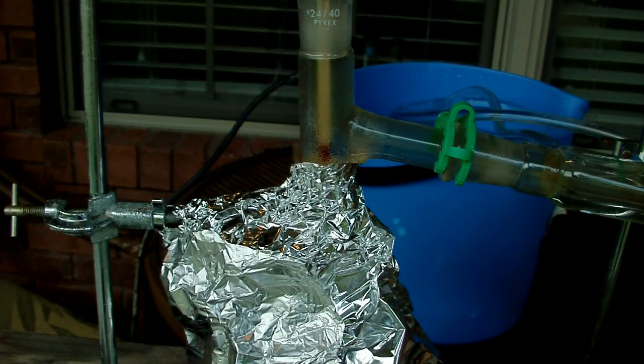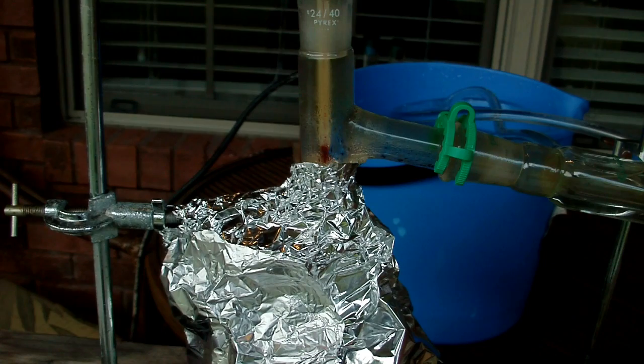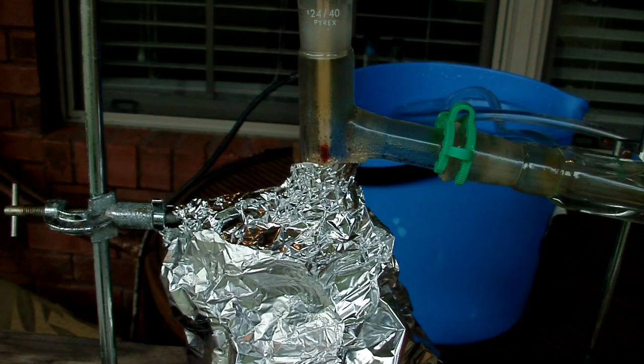So it's been about 10 or 15 minutes into the distillation. And you can already see why I did this outside. When you distill nitric acid like this, it very easily decomposes into nitrogen oxides, which when combined with atmospheric oxygen, almost always form nitrogen dioxide, which is this brown gas you see.